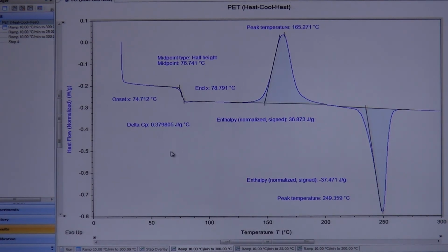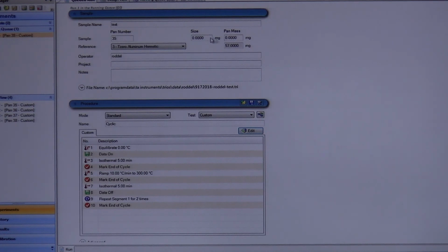So that's basically it. The last thing that we would do is that I would show you how to physically prepare a sample, and the two numbers that you would need to put in up here, where you would get them from.